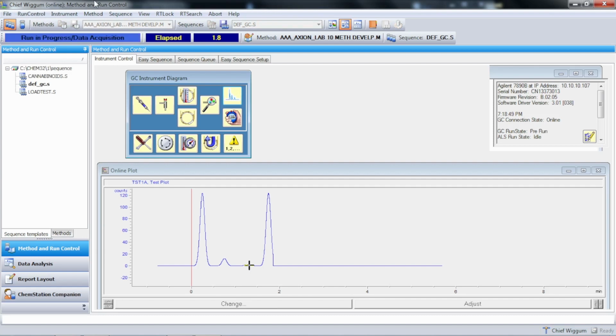So as soon as I hit start, we should see the red line appear, which is the 0 mark, and so it zeroes the timer, and now it's going to start in real time running a chromatogram. So the GC is putting out data points in real time, and those data points are being accepted by the data system, and that is what we're plotting. So there's the first peak, that's the biggest one, and then, like I said, it's 1.5 minutes.